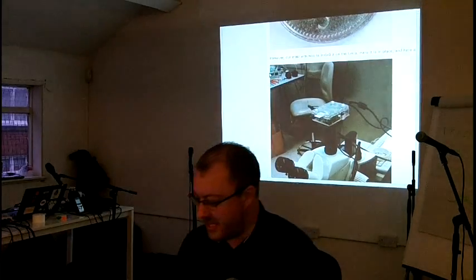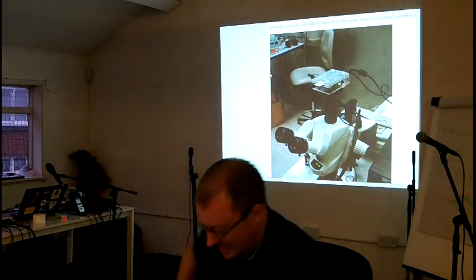Well, welcome everybody. This is Picroscopy, a quick live coding demo of how to integrate the camera into an application. To give you a quick bit of background, my wife works as a lab technician at the University of Manchester, and aside from playing around with extraordinarily complicated and difficult equipment, which I can't possibly understand, one of her other tasks is to deal with microscopes. At the moment, their method of taking images through microscopes is basically to take an extraordinarily expensive DSLR camera, strap it to the top of the microscope, peer down it and go, it's more or less in focus, isn't it? So we thought there may be a better way of doing this.